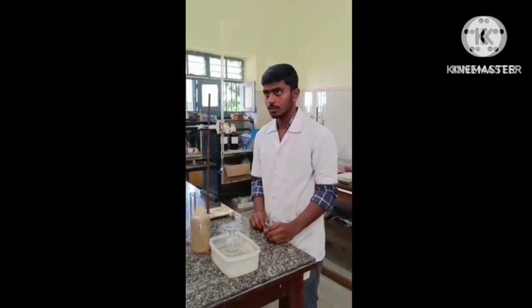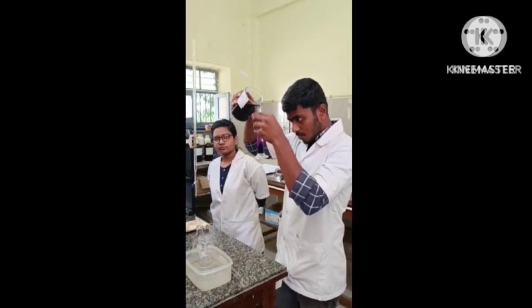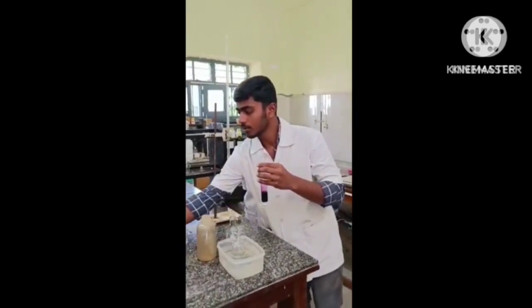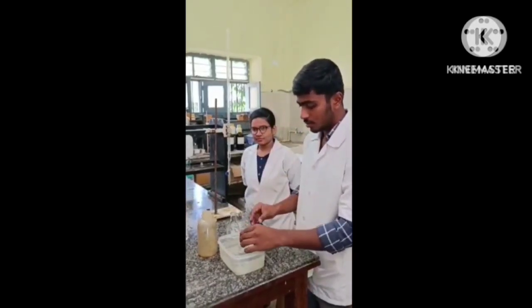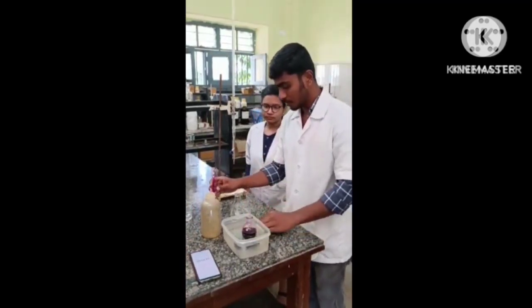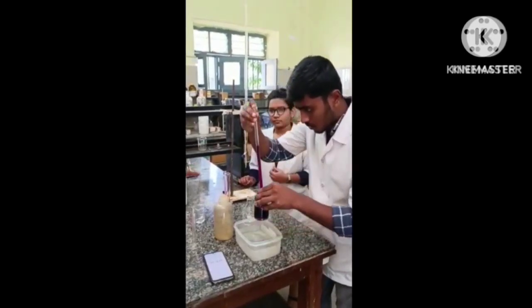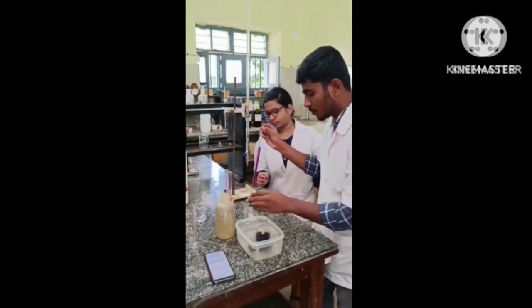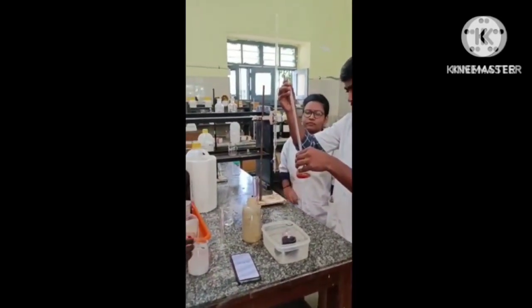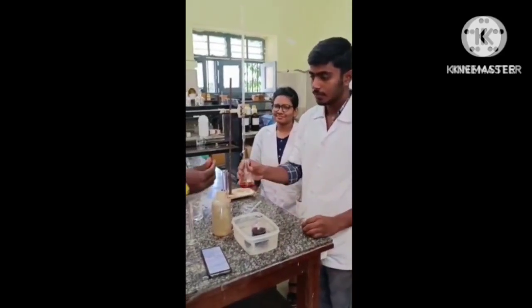Then keep the reagent bottle in a water bath. Then take 10 ml of potassium permanganate using a standard measuring cylinder and transfer it into the reagent bottle. While transferring the potassium permanganate to the reagent bottle, start the timer. After adding, immediately pipette out 10 ml of the solution from the reagent bottle and transfer it into a conical flask which is already having 10 ml of potassium iodide. Then add 2 to 3 drops of starch indicator.